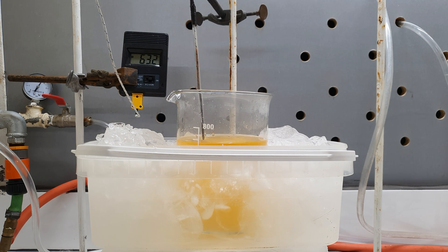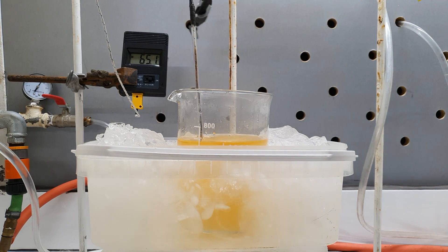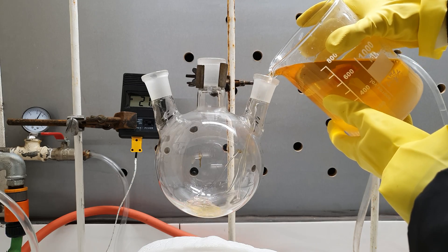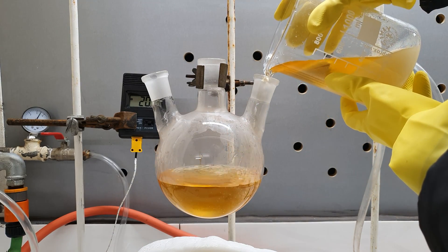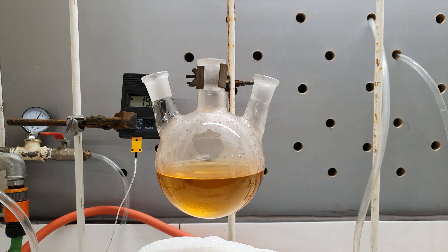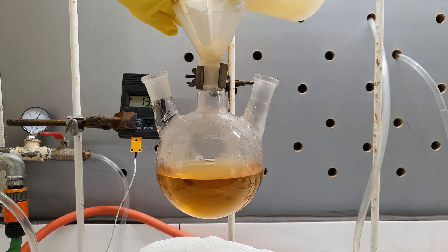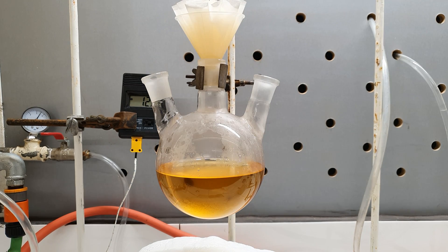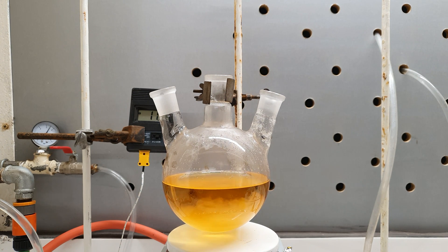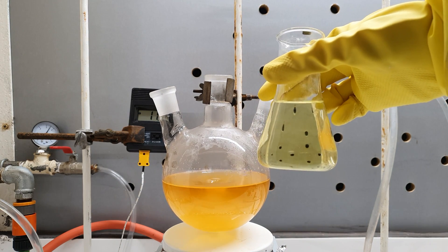I was afraid that due to the large amount of crystallized potassium sulfate the solution could start to bump. I decided to remove most of it by first cooling the solution in the ice bath to let most of it crystallize. Cooling too much, however, would result in all the contents solidifying. The next step was to decant most of the solution into my three-neck, one-liter round-bottom flask. The final portion could not be decanted, so I opted for a simple gravity filtration through filter paper.